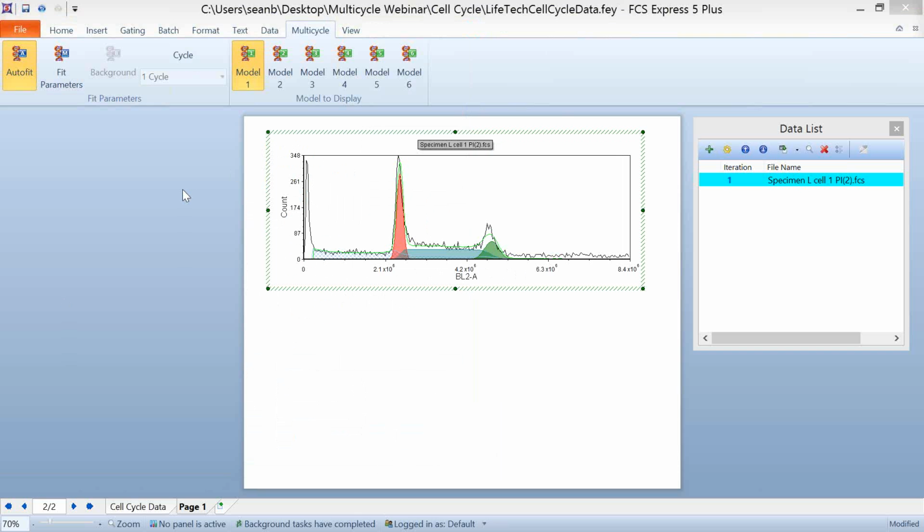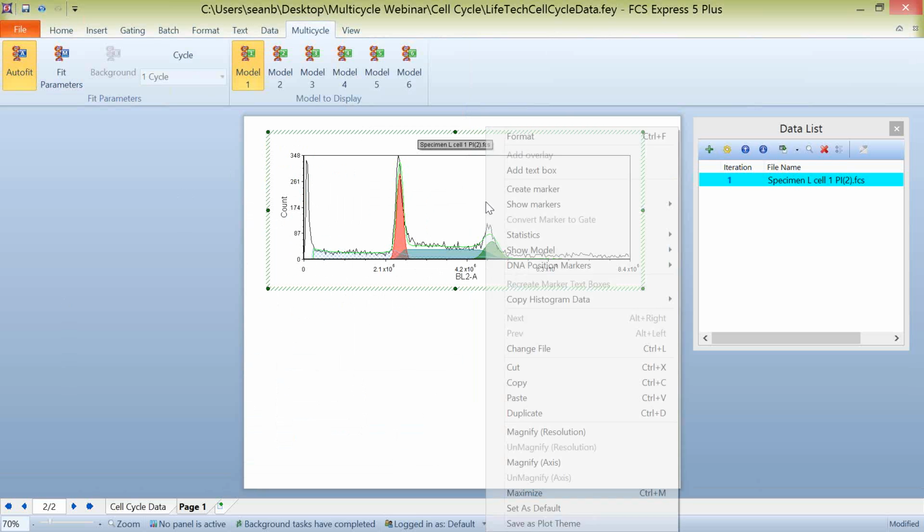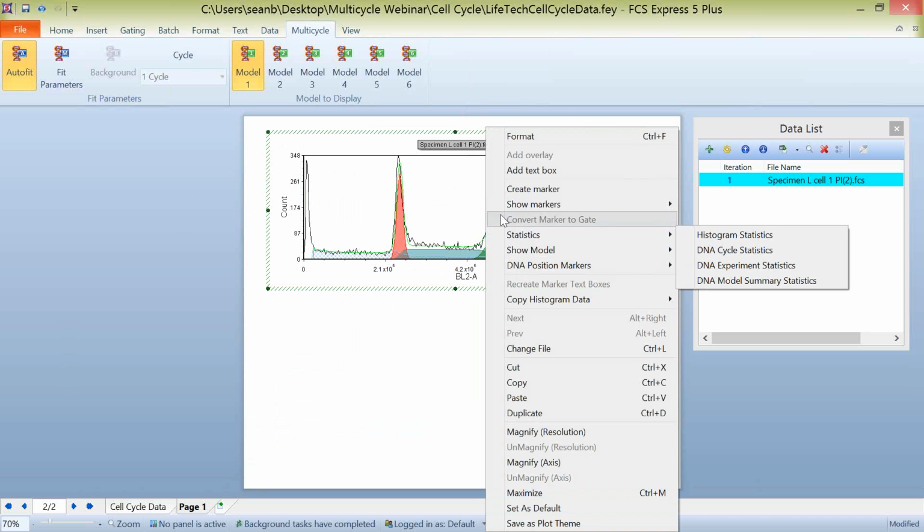So once you have that plot inserted and you have it formatted however it is that you want to look at that, what we can do is actually start deriving some statistics for this multi-cycle plot. So if I right-click on a plot and I choose statistics, rather than a regular histogram, we now have the ability to choose DNA cell cycle statistics, DNA experiment statistics, and DNA model summary statistics. So I'm going to insert all three of these.